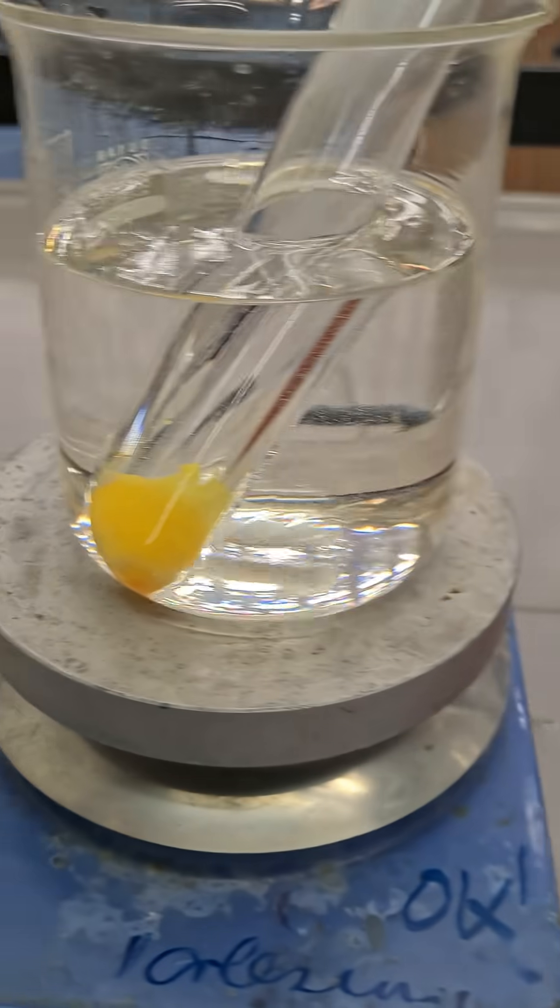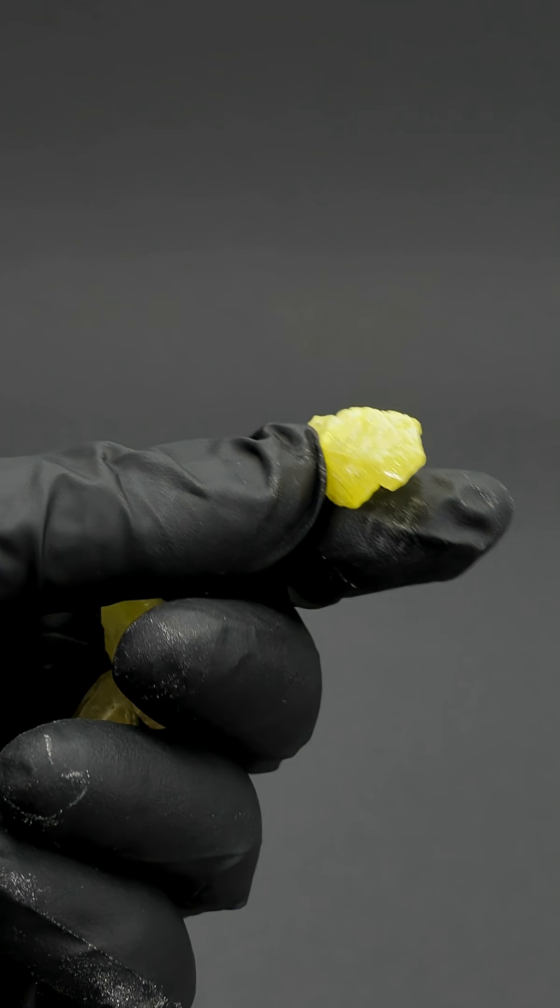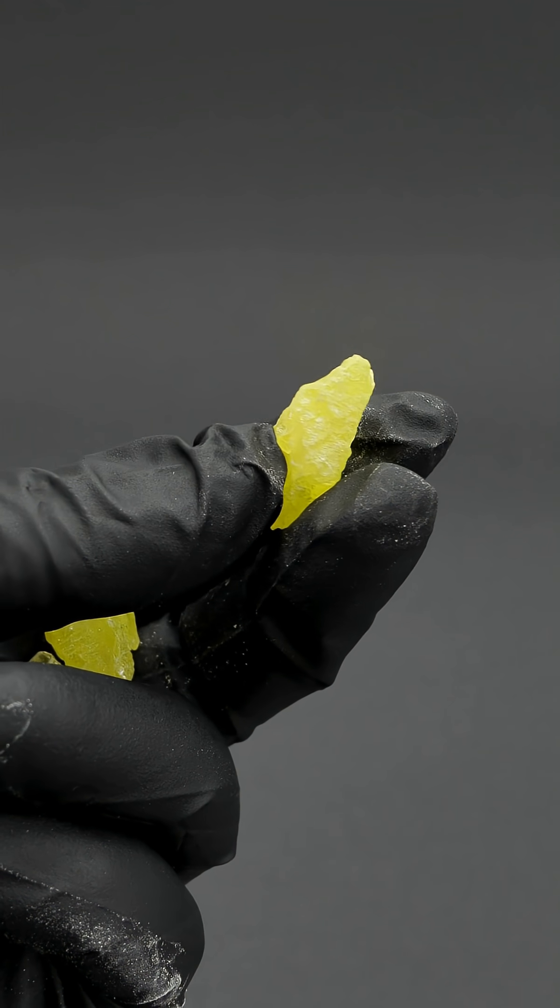Gamma sulfur forms when heating sulfur to 160 degrees Celsius, or this, crystalline sulfur. Crystalline sulfur is actually composed of somewhat clear yellow crystals.